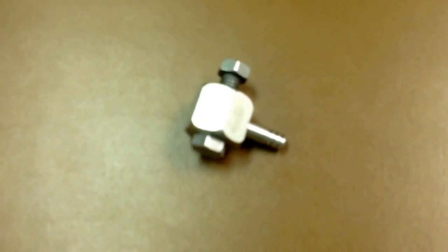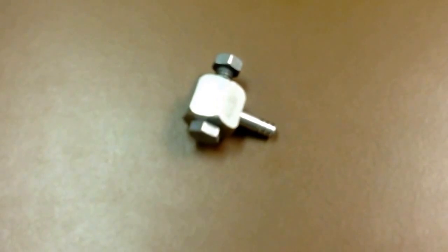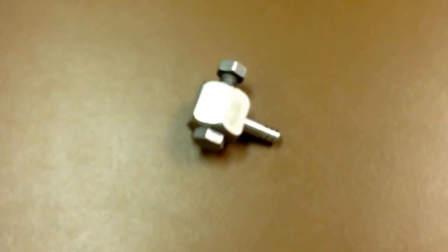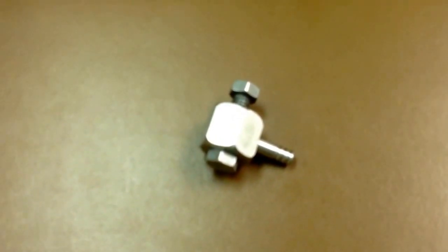Now you can see the full assembly. I've tightened this with the wrench. You need to get it good and tight, but you do need to be able to unscrew it, so this is always sometimes a fun experience. But, like I said, a hydraulic press works really easy when you have that available.